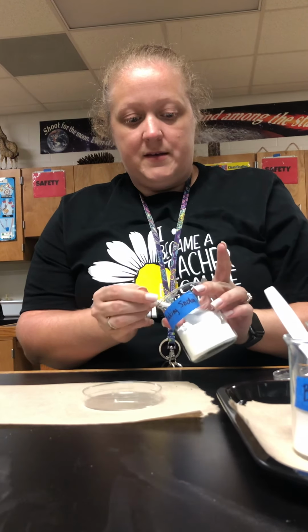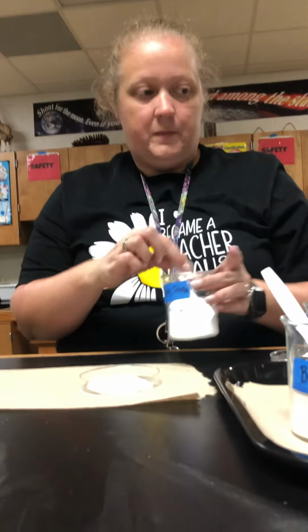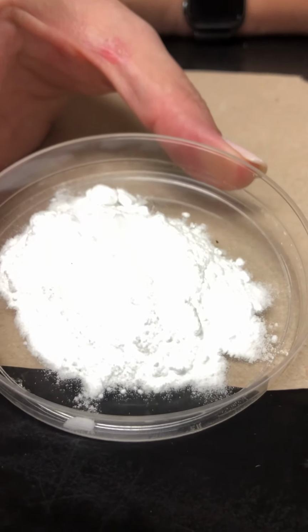On the next substances, I'm going to let you answer, so be paying attention so that you can fill in your answers on what happened with each substance. Now we're going to do the same thing with baking soda. I'm going to take baking soda and make some observations about its physical properties.